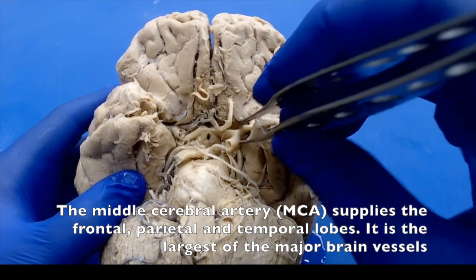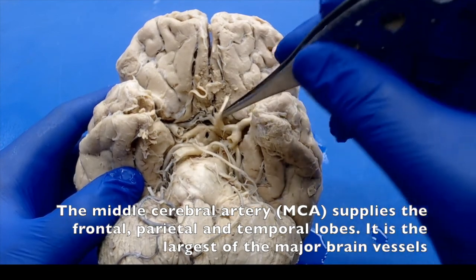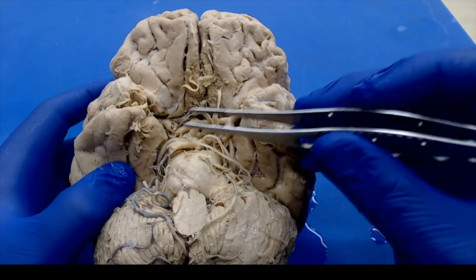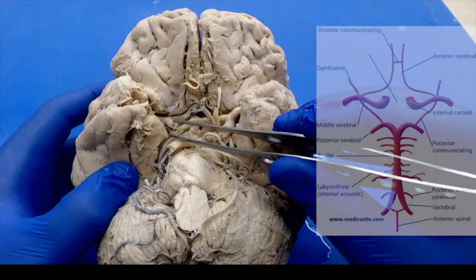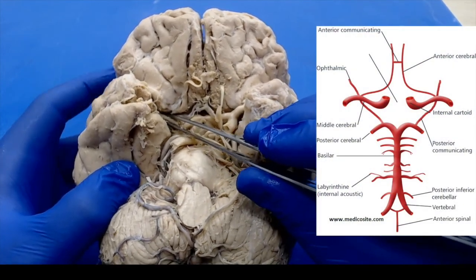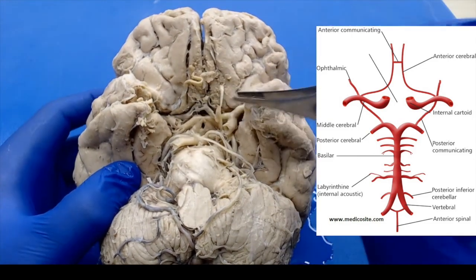Additionally, just off the internal carotid, and I don't know if we have a good example of it here, but you'll also be able to find your ophthalmic. And it's not really easily seen on a lot of brains, depending on how well you're resected, but that'll be going up towards the anterior portion. So we have our internal carotid, middle cerebral going up between that lateral sulcus, supplying the parietal lobe. Then we're going to get an anterior cerebral coming off of that, which we see here.